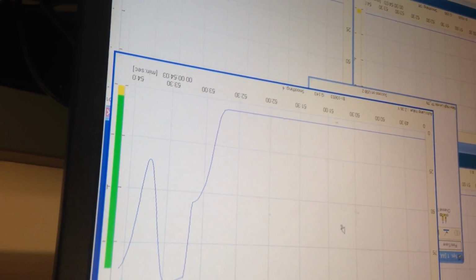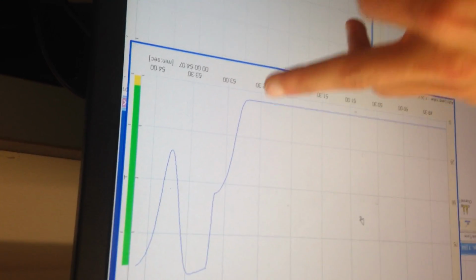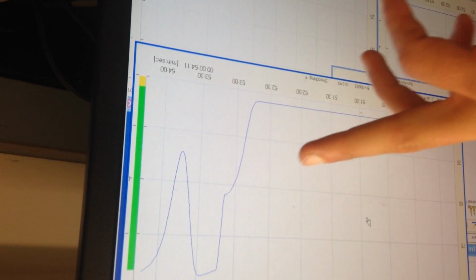But you did that before. I did that. I wanted to see what the machine was doing with the 85 gain, and on 85 gain, it was going to plateau at 55%.